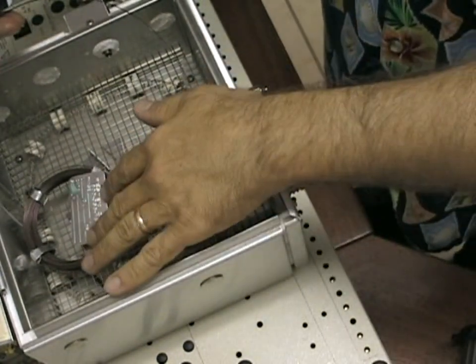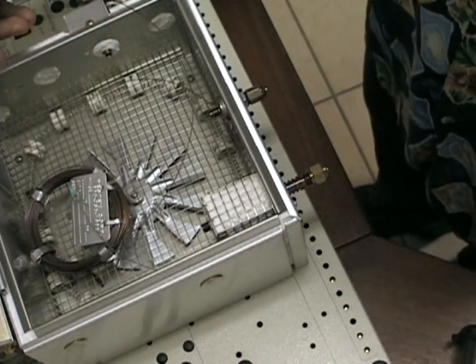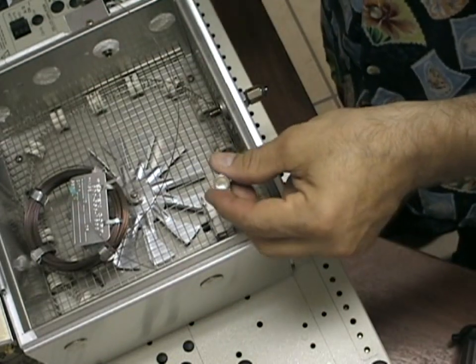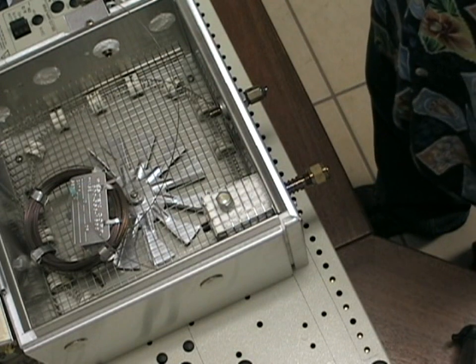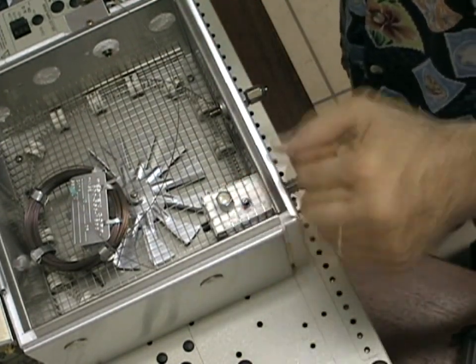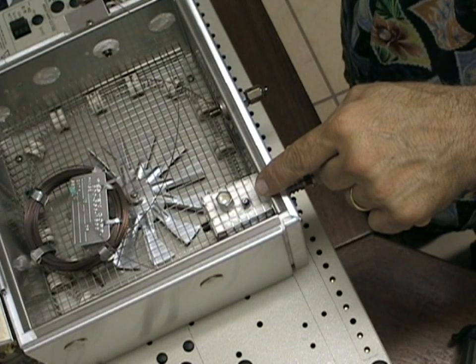The stainless steel capillary column is used for most fermented beverage analysis. You will use a stainless steel nut and the graphite ferrule that is designed for use with the megabore capillary GC columns.